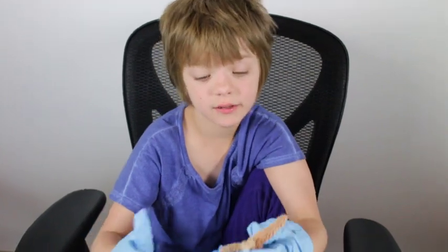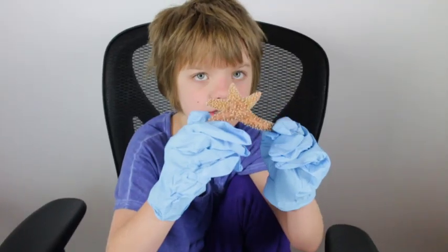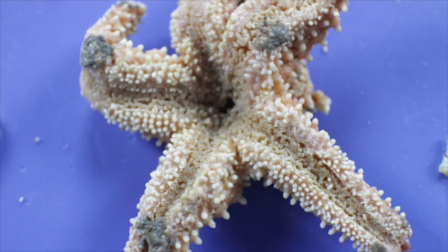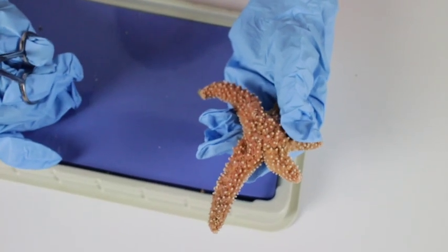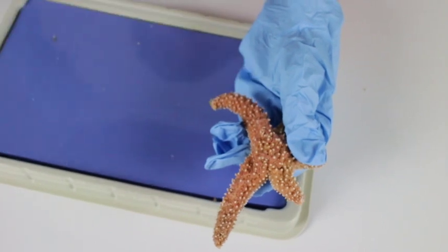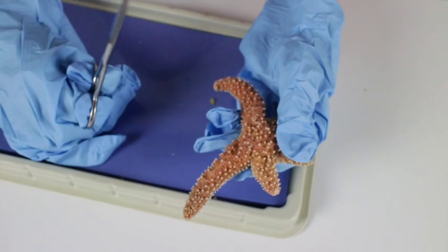A starfish is an echinoderm, which is a phylum of marine animals. This here is the aboral surface — the spiky side you see when looking at a starfish at the aquarium — and this is the oral surface, where the mouth is, and it has lots of little tube feet all over. A starfish is radially symmetrical, which means cutting down any plane resembles a pie you can cut into identical segments like flower petals. You can cut through any of the arms and they would be symmetrical on both sides.